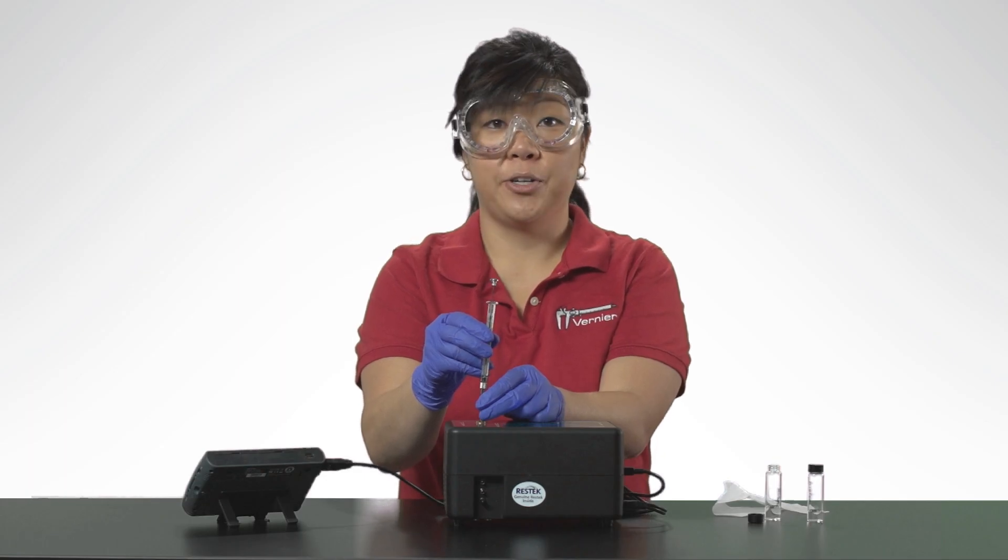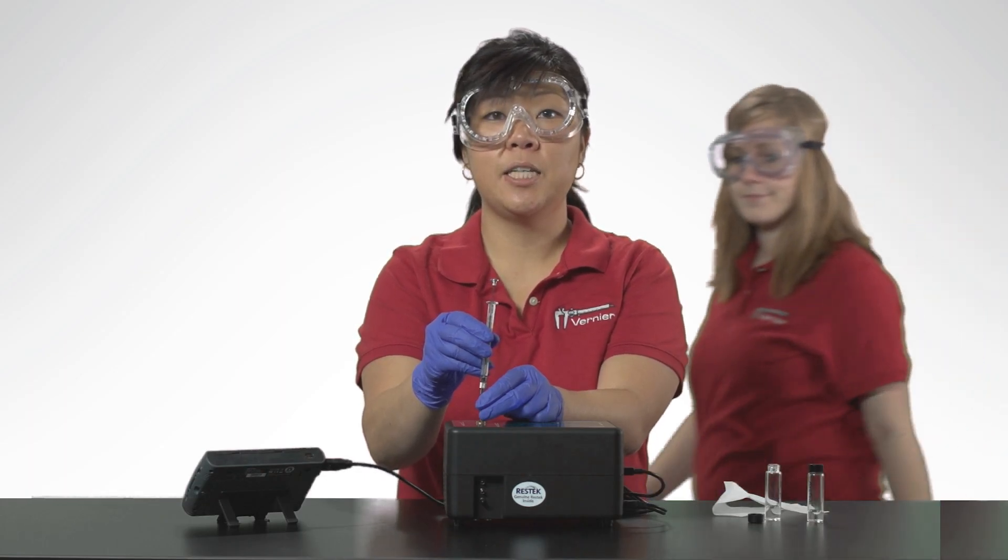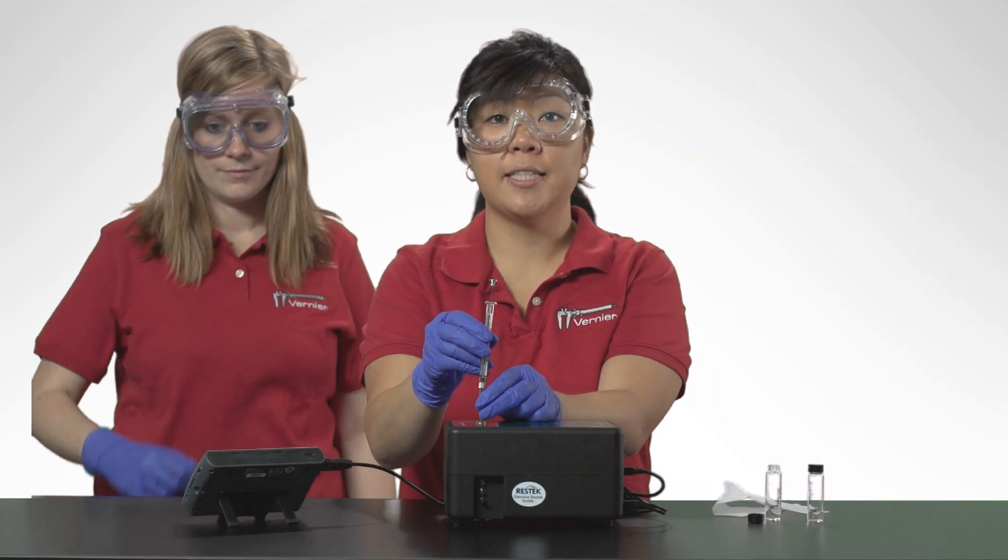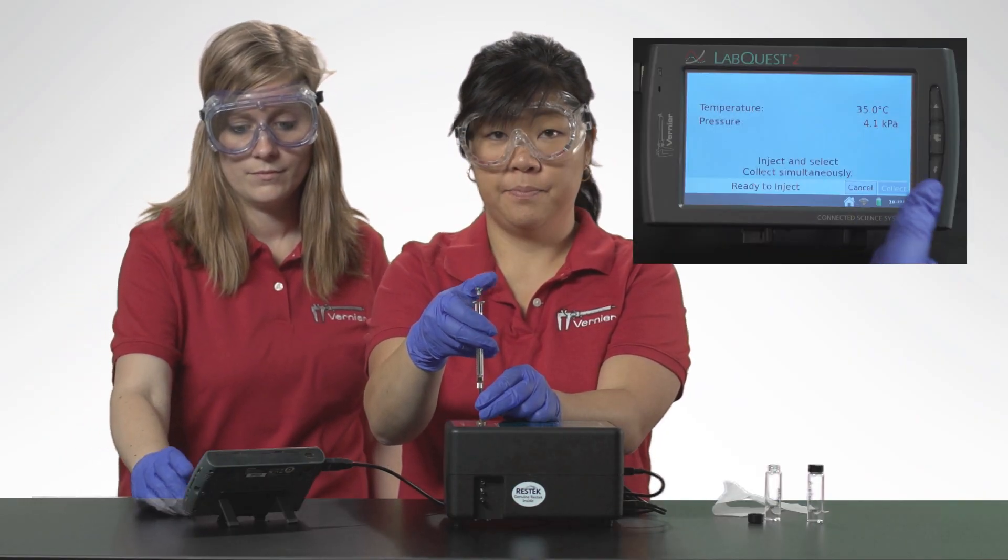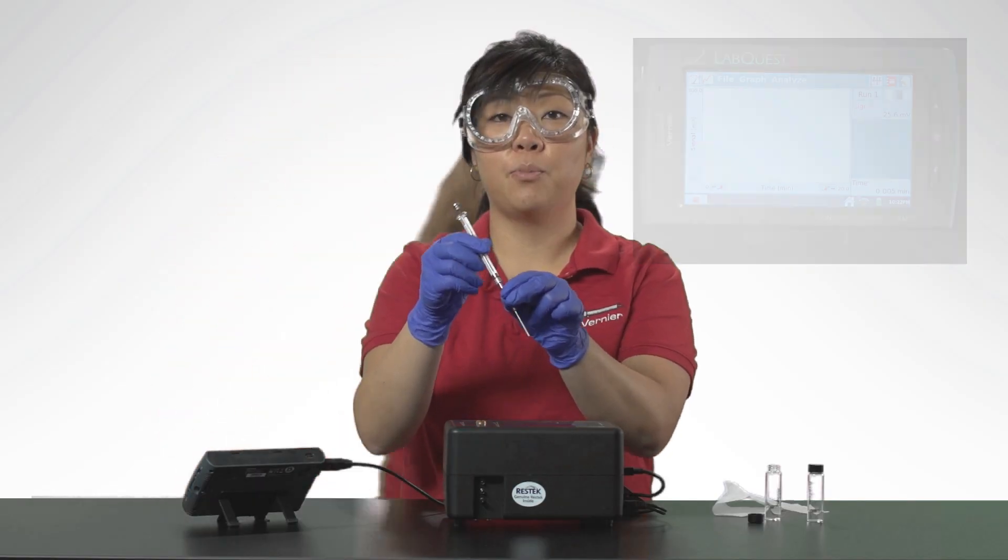With the help of my lab partner, I will simultaneously depress the syringe plunger and select collect to begin data collection. Pull the needle out of the injection port immediately.